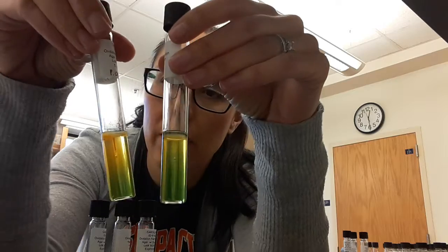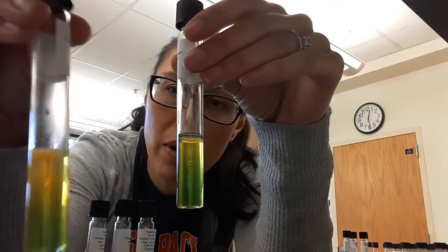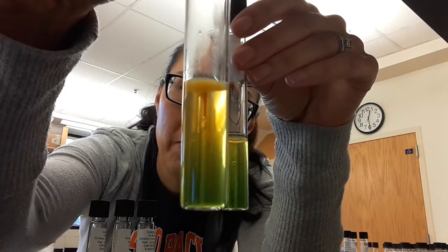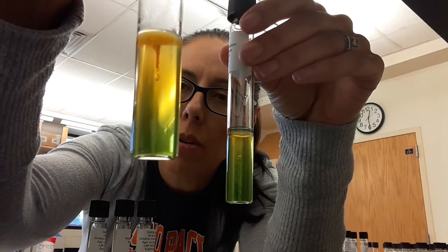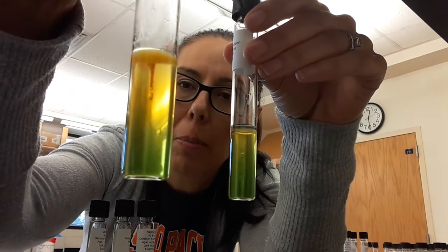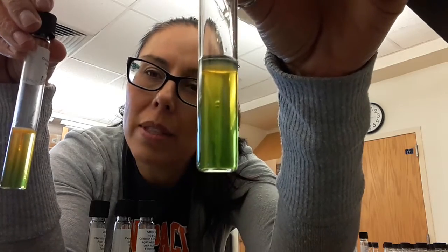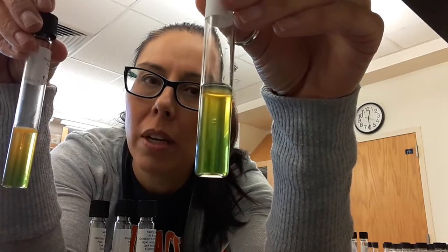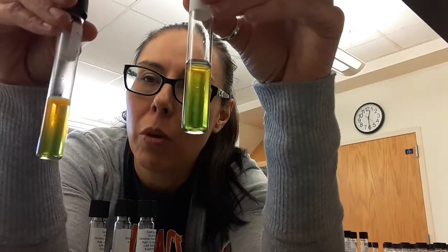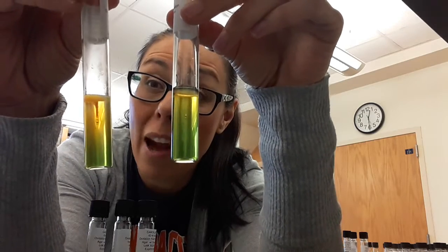Or if we look at another one, and this is a negative control, this is Pseudomonas aeruginosa. So this is the one without the mineral oil. So this is the one with oxygen. And it's not as yellow as the E. coli one, but that's okay. That still gives it a positive. And this is the one without oxygen. And it's a little bit yellow at the top, and that's probably because there's a little bit of oxygen getting in there, and the mineral oil wasn't as thick as it needed to be. So we consider Pseudomonas an obligate aerobe.